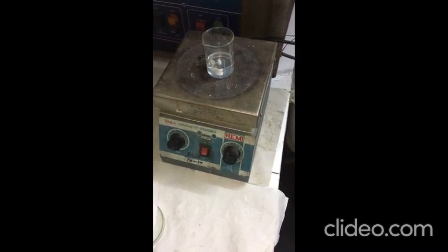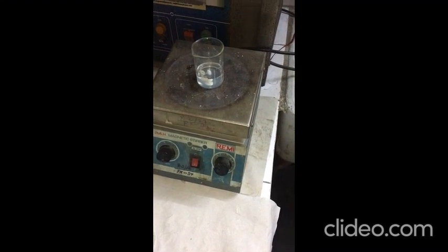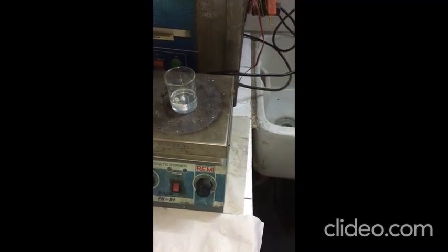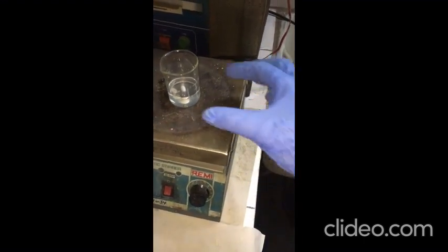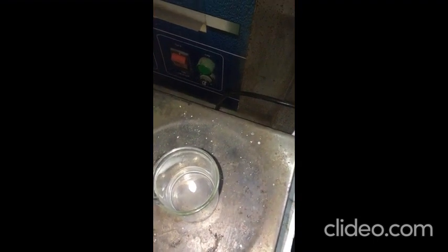Today we will discuss magnetic stirrers. We will make a solution using magnetic stirring. This is the magnetic stirrer and this is the solution. Inside there is a magnetic stir bar.